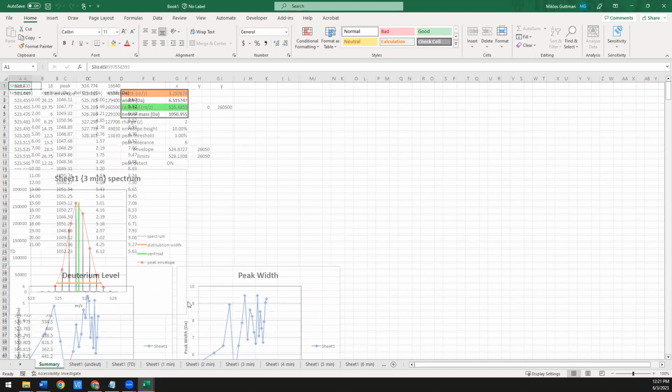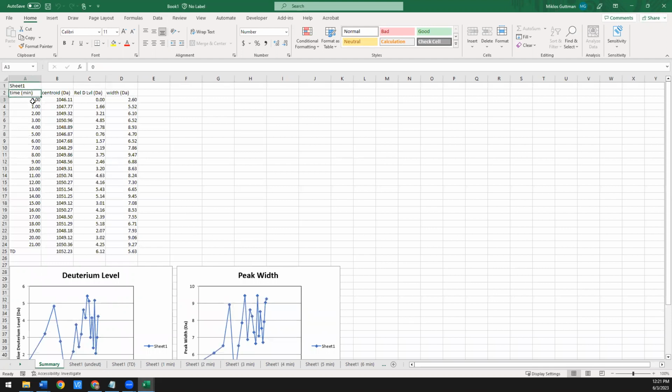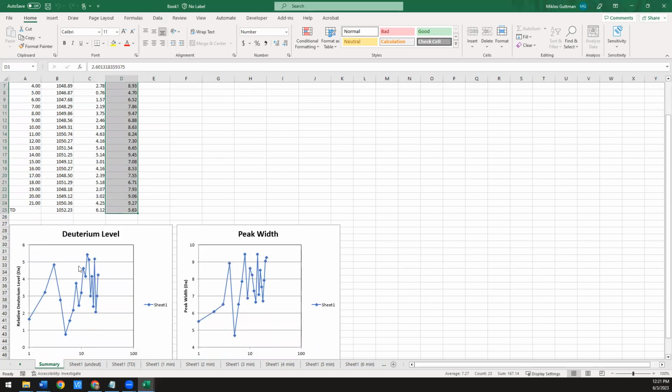The summary has all the information for all these time points and what the centroid was in absolute mass, what the relative deuteration is, and also that width at 10% max height. And down below are the plots. This is the centroid as a function of what time point it was, and this is the width.